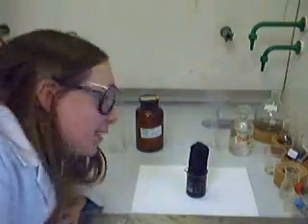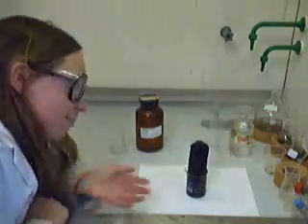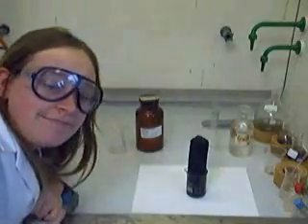So there we go — we have a big column of carbon, black carbon. The fumes coming off are actually the water that the sulfuric acid has taken away from the sugar.